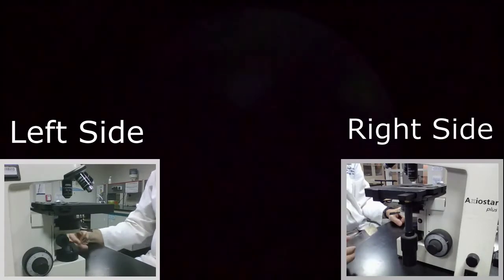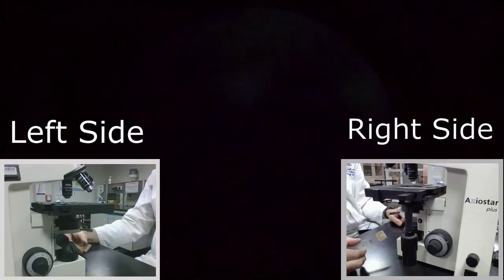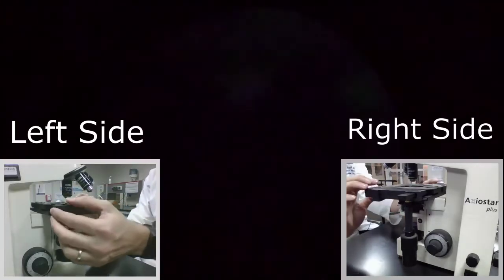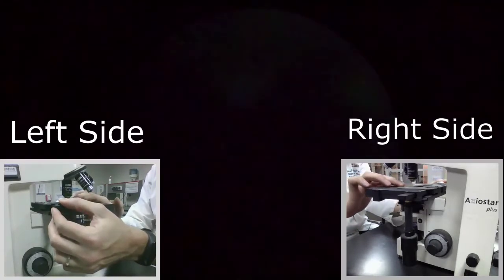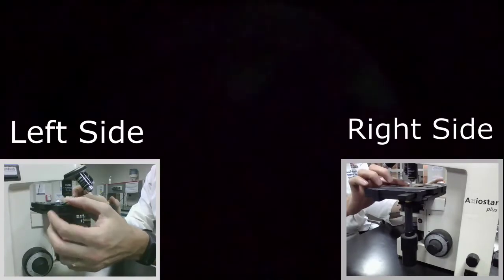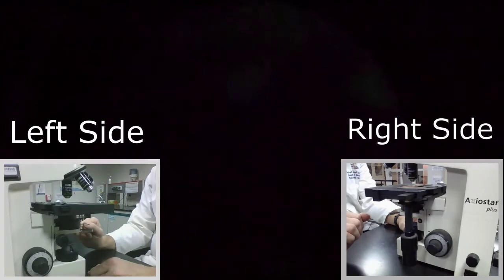So what I have here is a slide — this is a composite slide that has a few different organs on it, which in this case is a small intestine. I'm going to place it on top of the stage, open up the clip, place my slide inside, make sure that it's snug against the edges of the slide holder, release the stage clip, and now my slide is securely in place.